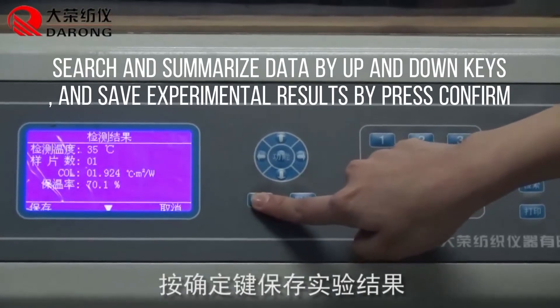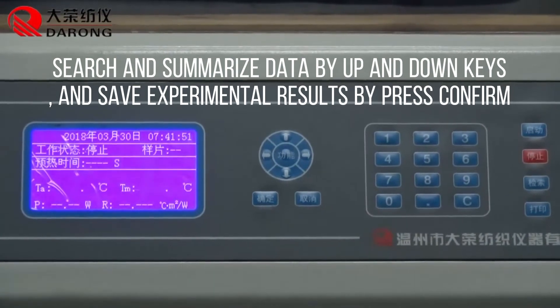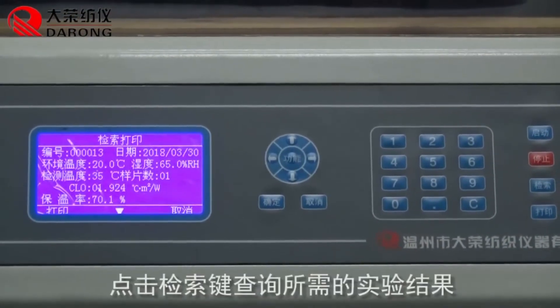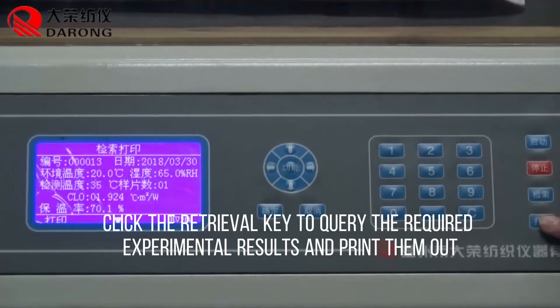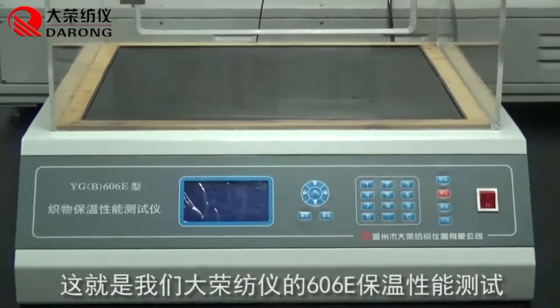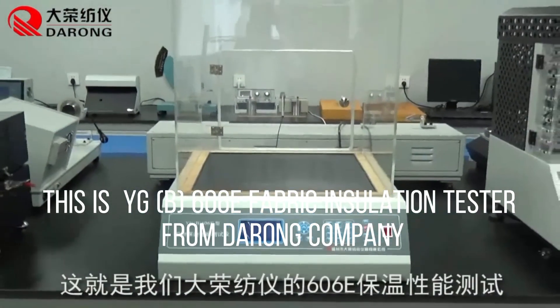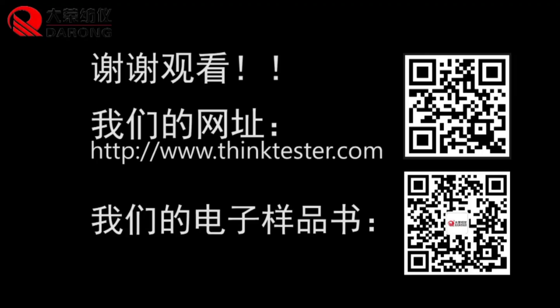Search and summarize data using the up and down keys, and save experimental results by pressing confirm. Click the retrieval key to query the required experimental results and print them out. This is the YGB-606E Fabric Insulation Tester from Daron Company.